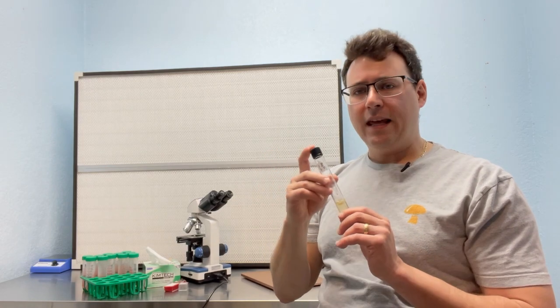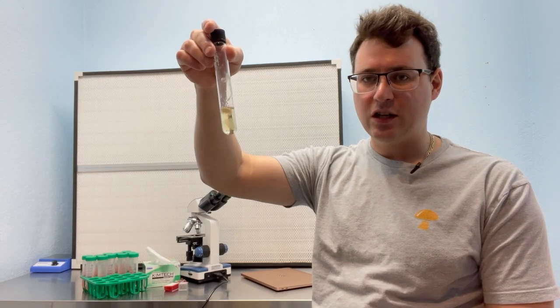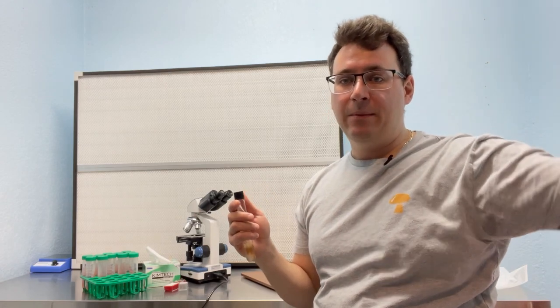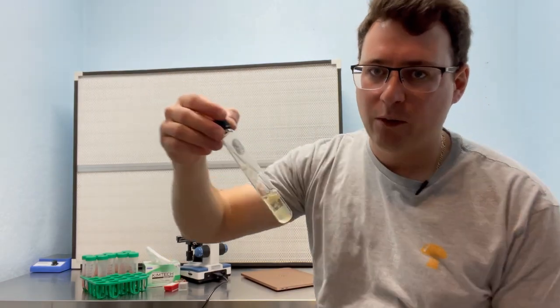One of the issues that I have with my process is that when it's freeze drying, it's vacuuming air from the ambient room next door, and that is causing a small amount of contaminants to get into the test tubes that I'm using for freeze drying. Now, there's still a benefit to having backup cultures that are just freeze dried because I can set them in a box and leave them in the back corner of my lab, and I won't have to worry because I'm getting pretty good rates of reanimation of that freeze dried mycelium.